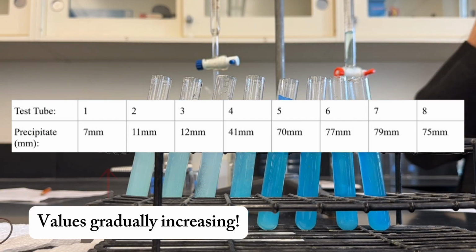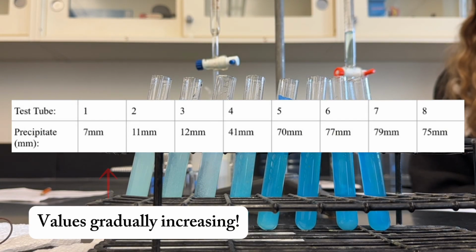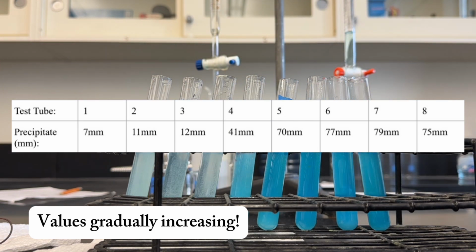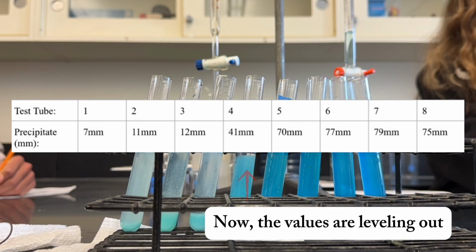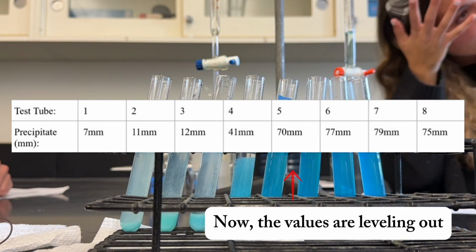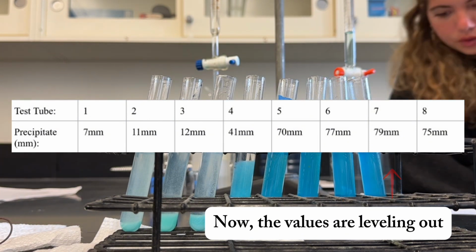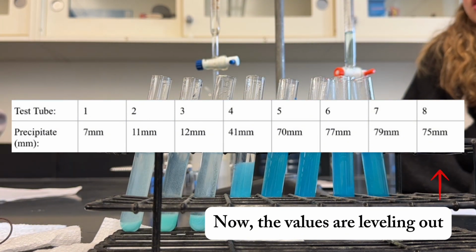Results for that: test tube 1 measured a height of 7 mm of Cu(OH)2 precipitate, test tube 2 a height of 11 mm, test tube 3 at 12 mm, and test tube 4 at a height of 41 mm. Test tube 5 reached 70 mm of Cu(OH)2, test tube 6 reached 77 mm, test tube 7 reached 79 mm, and test tube 8 was at 75 mm.